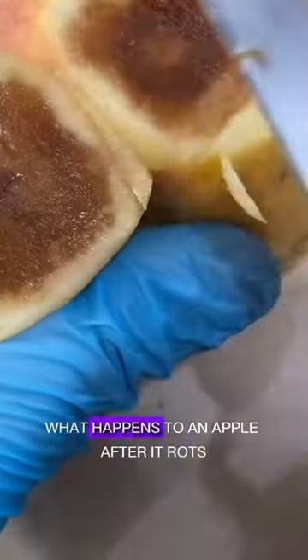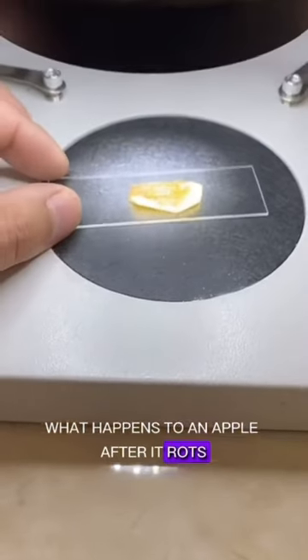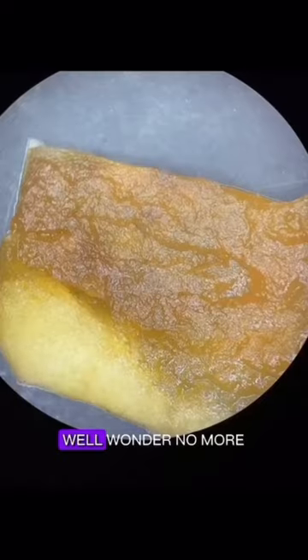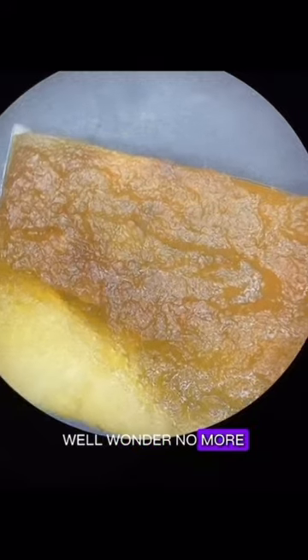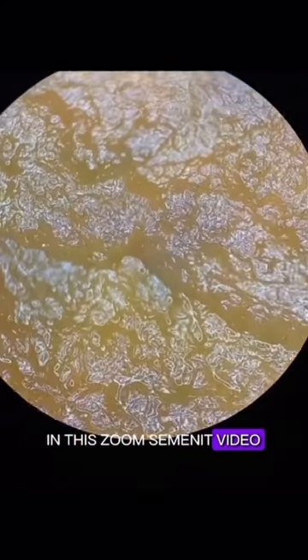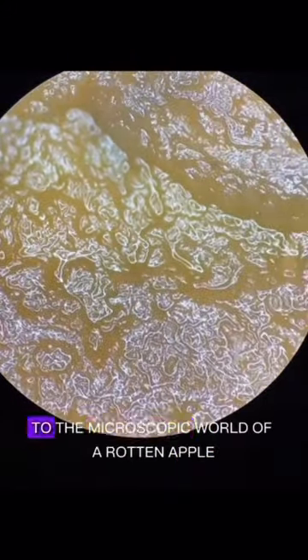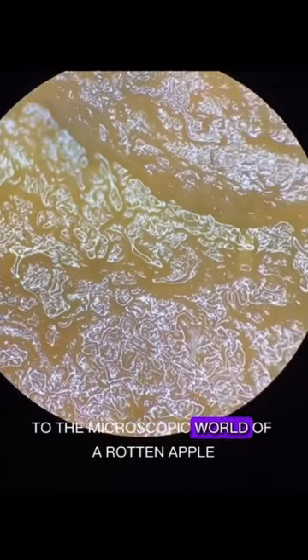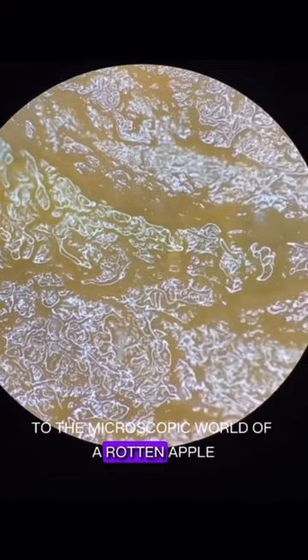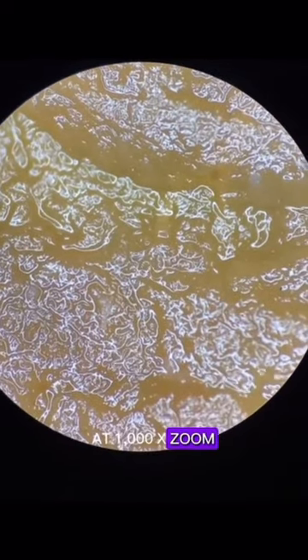Have you ever wondered what happens to an apple after it rots? Wonder no more in this Zoom-in minute video. We're taking you on a journey to the microscopic world of a rotten apple at 1000x zoom.